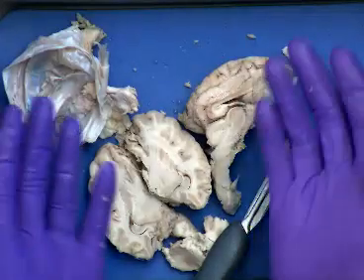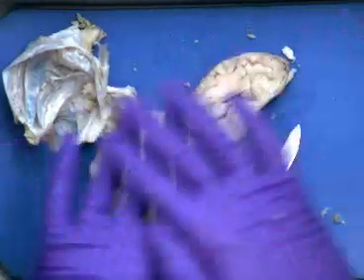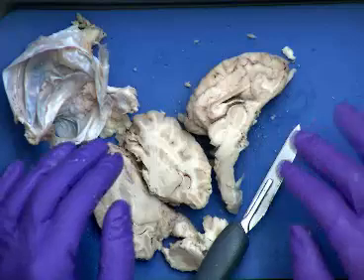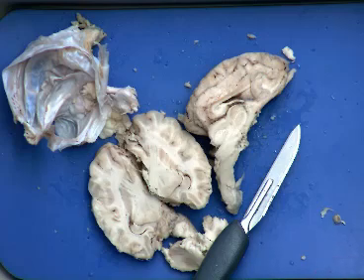And then when you set the trays, you can stack up the trays and take that insert and rotate it 90 degrees so there's a little bit of air that gets in there as well. Okay, don't worry about it if they're still a little bit wet, or just allow them to dry over the weekend. Okay? Alrighty. So when you are ready, go grab yourself a brain, an extra brain there, and we can do our sheep brain dissection.